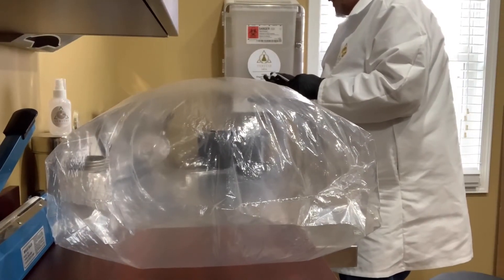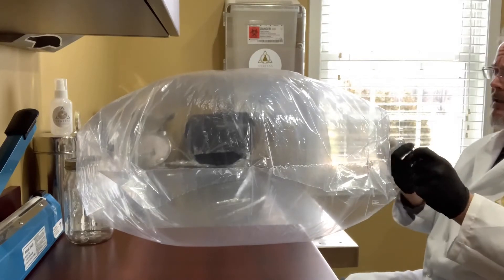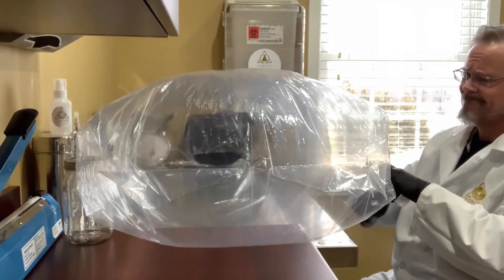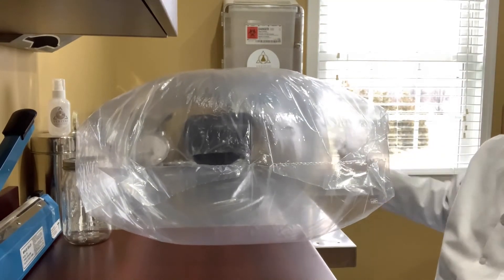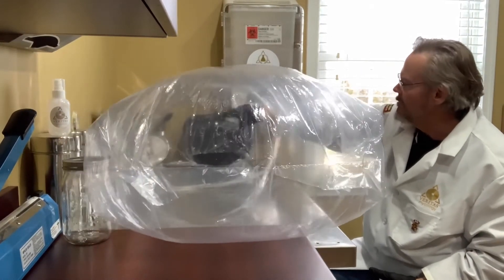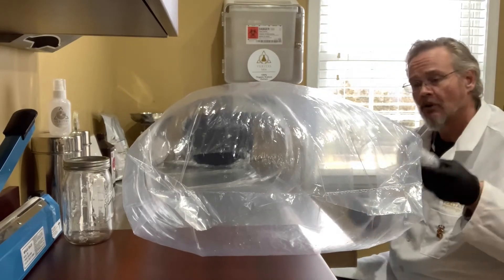Make sure you're being safe and recap your blade. If you find you've made your holes a little too big, turn the power up. If you haven't sterilized beforehand, spray this bag inside and out with ISO — I recommend you do. Make sure your hands and everything else is sterilized as well. Spray the outside around your holes and your flaps, then go inside and spray your unit inside. The exhaust blowing out generally takes care of any issues. Wipe down your ISO bottle and leave it in there.